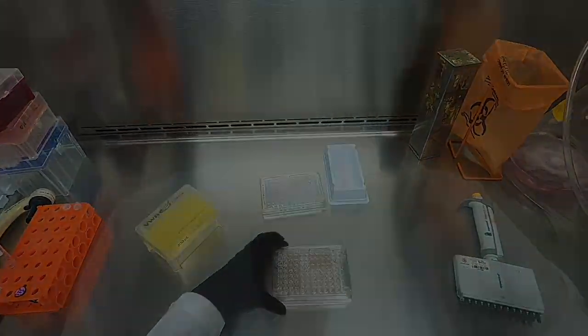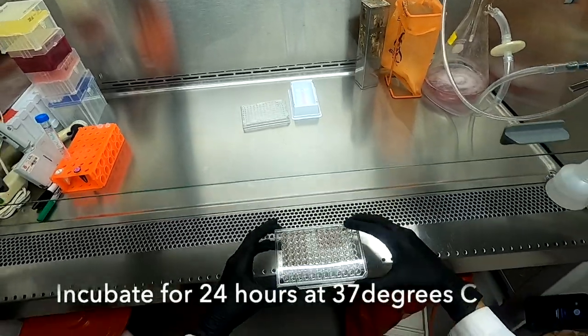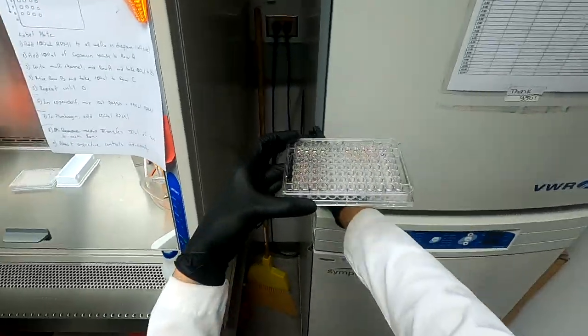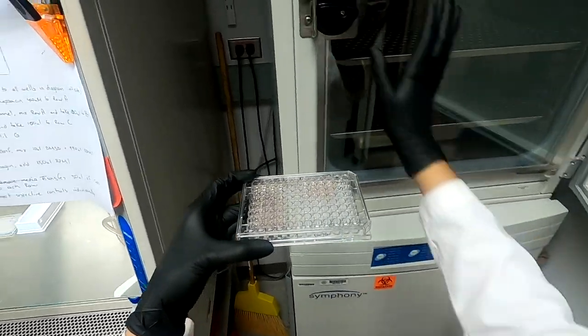We have just finished day two of our experiment. We can now incubate the plate for 24 hours in our incubator prior to analyzing using crystal violet dye.